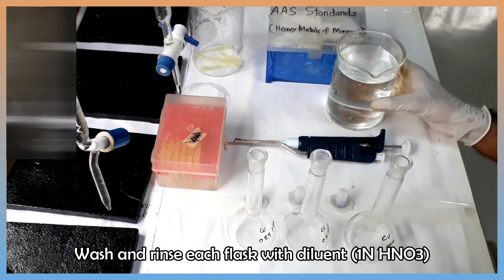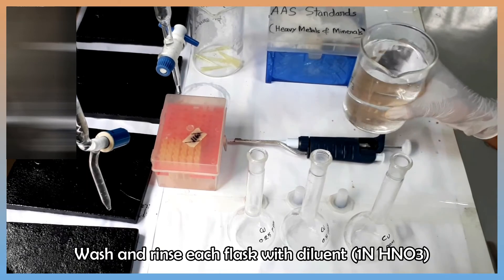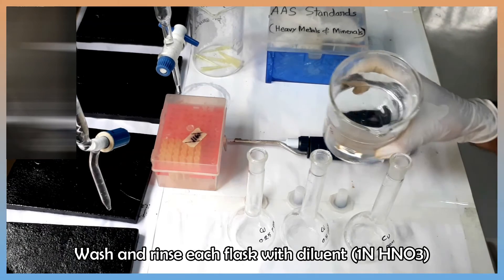Now, rinse each of the flasks with the diluent.